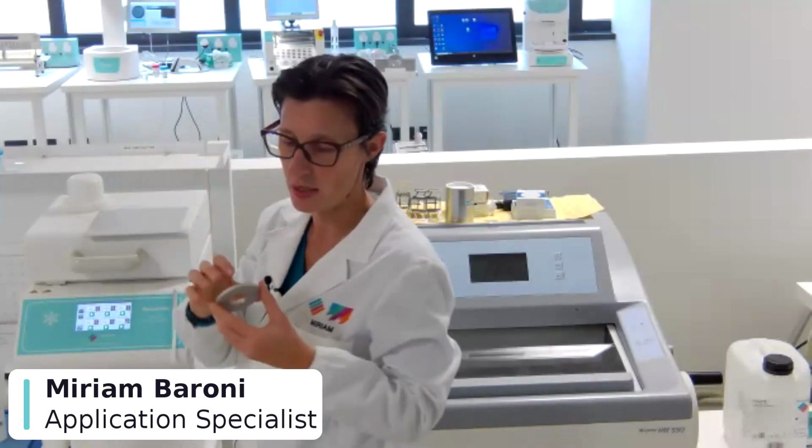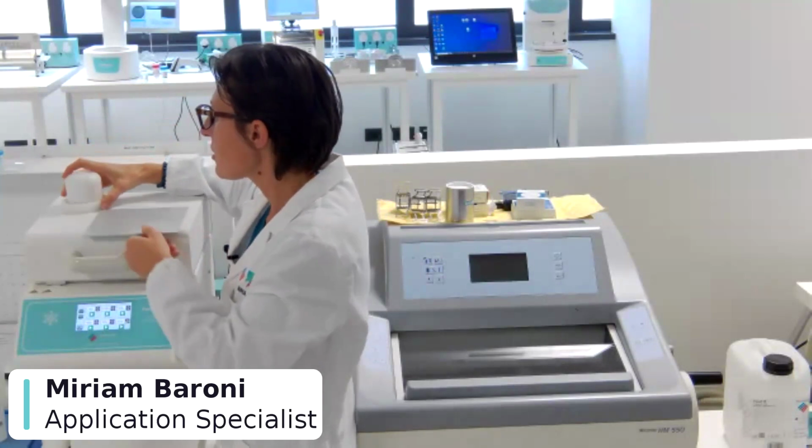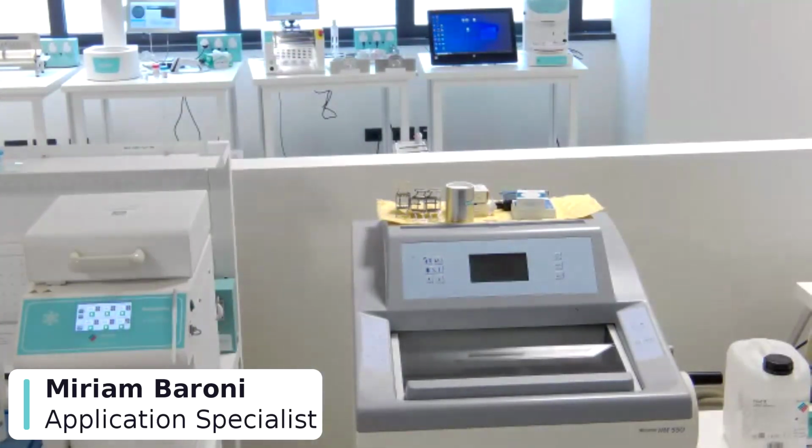At the end of the freezing, of course, the block will be linked to the ring, but we can use this tool to easily push down the ring and pop up the chuck from the inside of the ring. So both methods give a very good result, because the freezing at -40 degrees allows a very good result. And the best way to understand which is the most helpful, the most correct protocol for your own lab is to do a demonstration. In this way you can try both methods and understand which is the best one for you, because sometimes it's a personal impression.